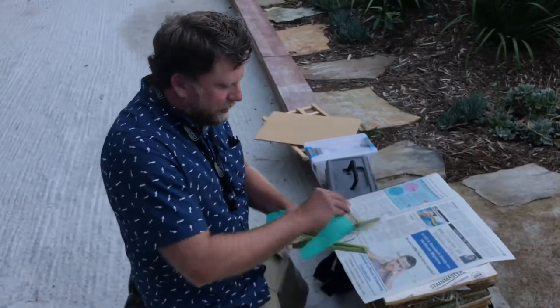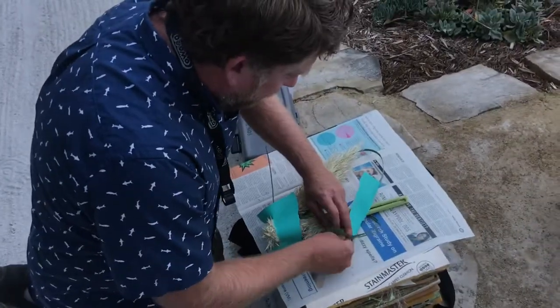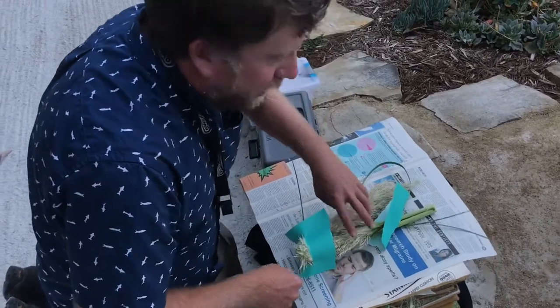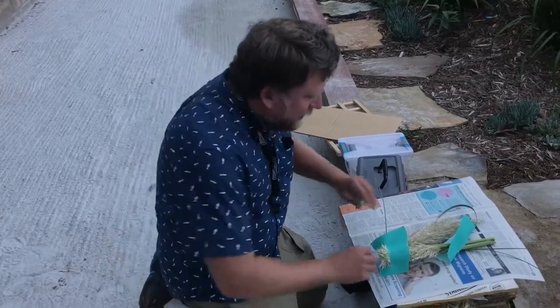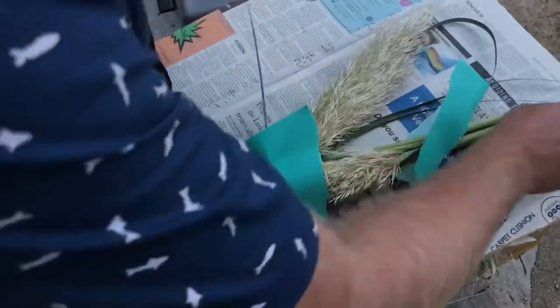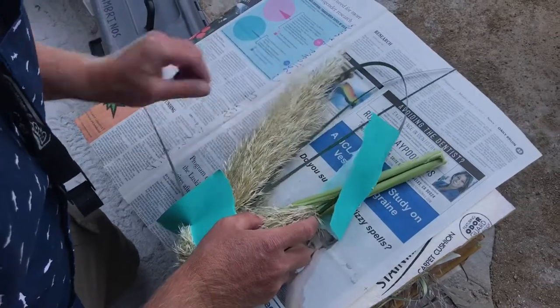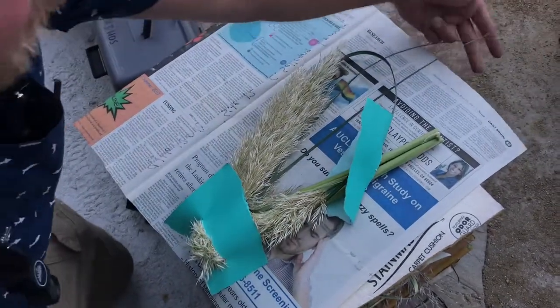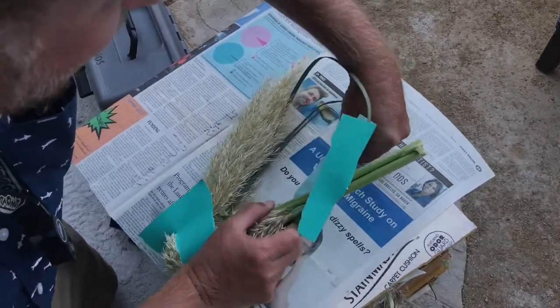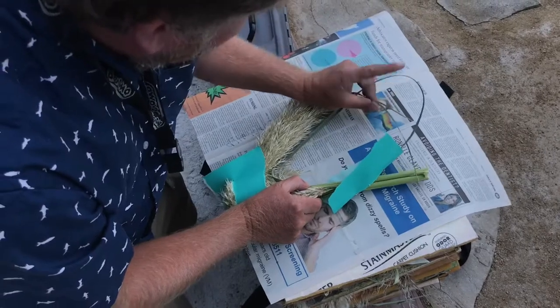We put it in the press to do two things: one is to make it lie as flat as possible and squeeze it down, but also to get it to dry. Once it dries, it will be relatively impervious to rotting, because we want this stuff to be preserved in perpetuity. Grass is relatively easy. Other plants with much higher water content are much more tricky. We're also in a pretty good climate for this — imagine traipsing through the middle of the jungle in an Ecuador cloud forest and trying to press these things; they could rot before you get to any civilization.